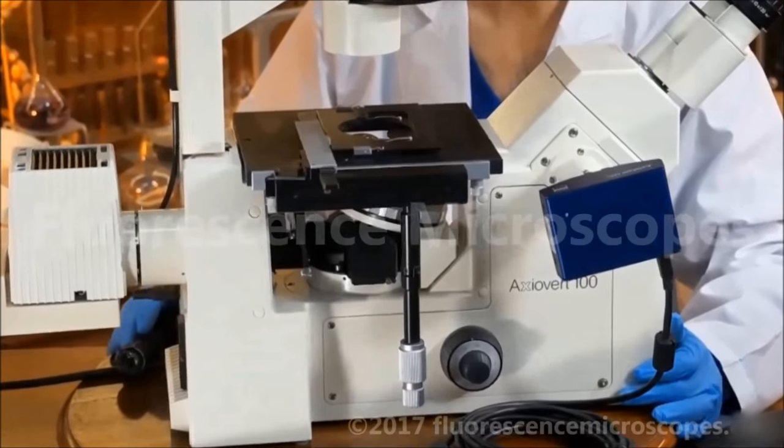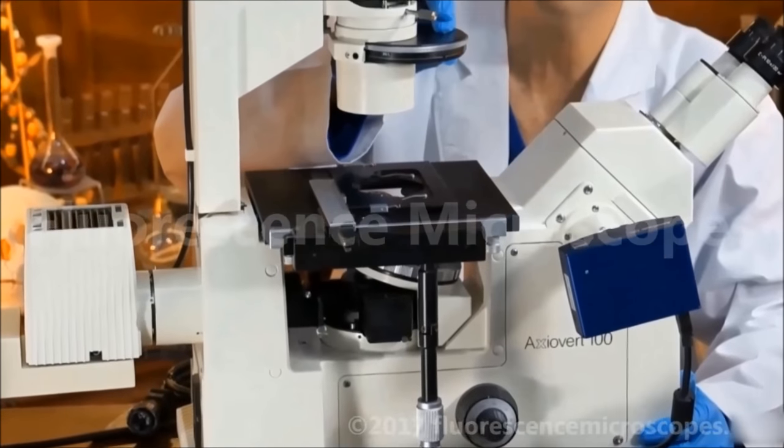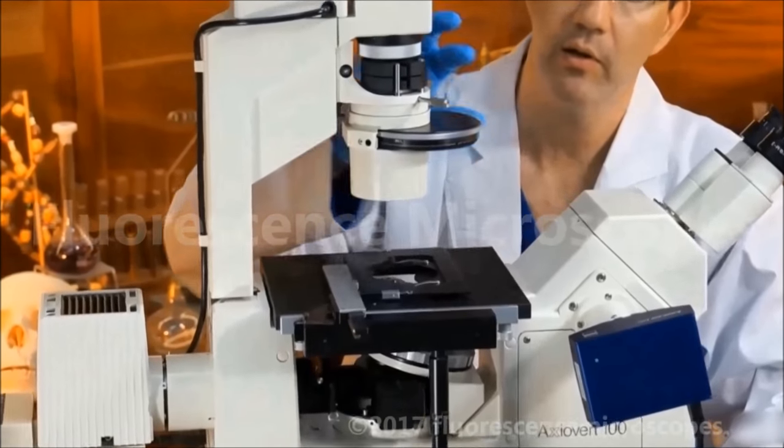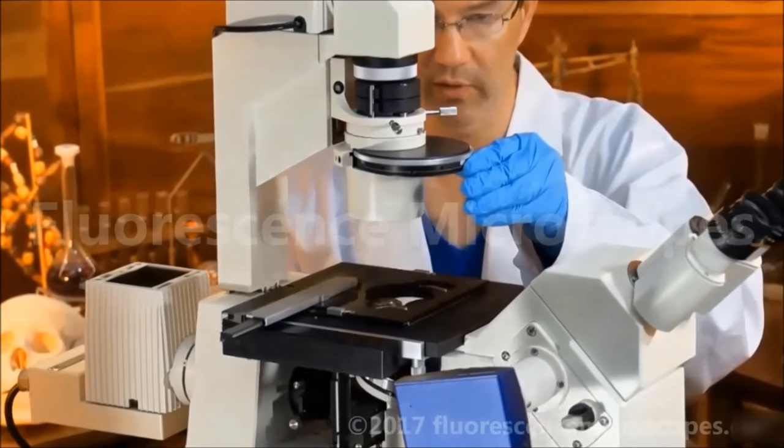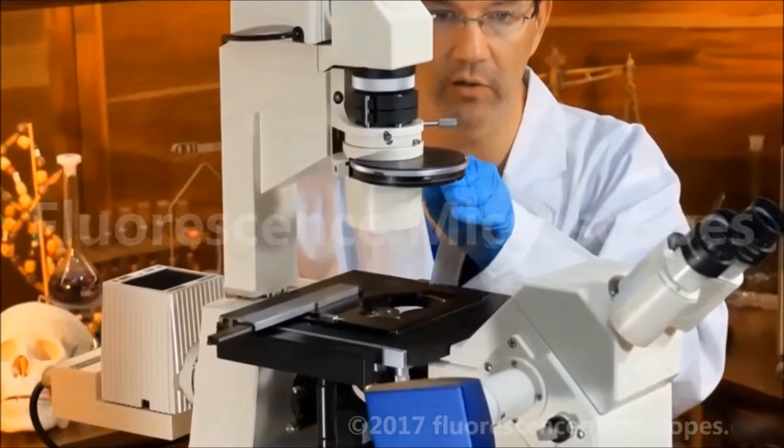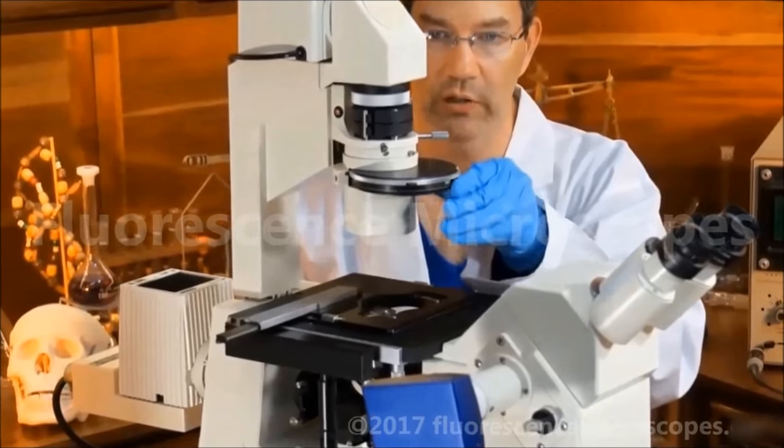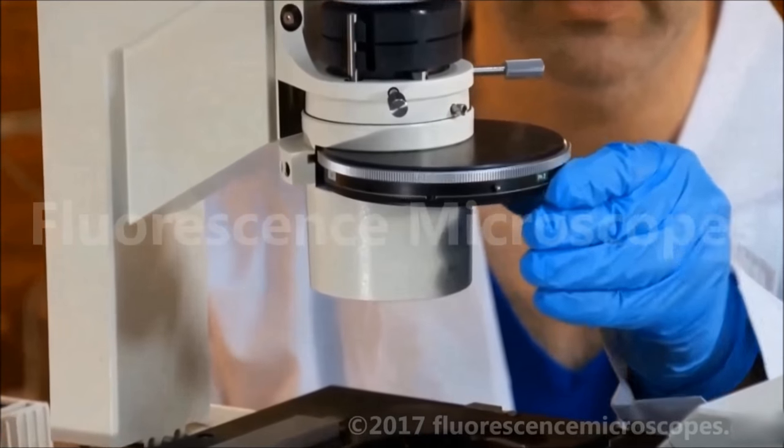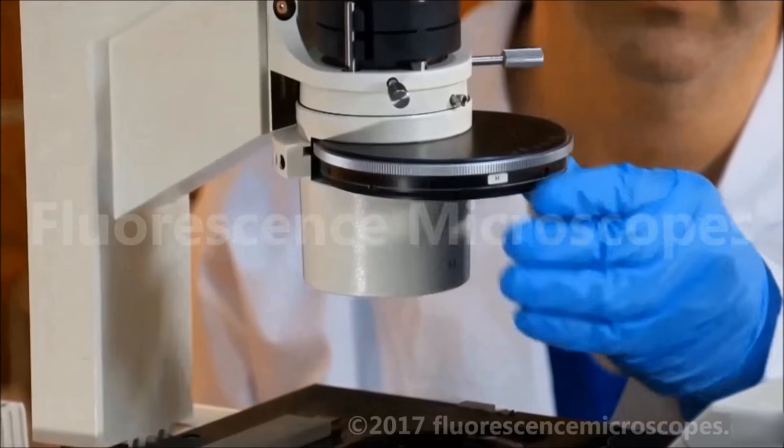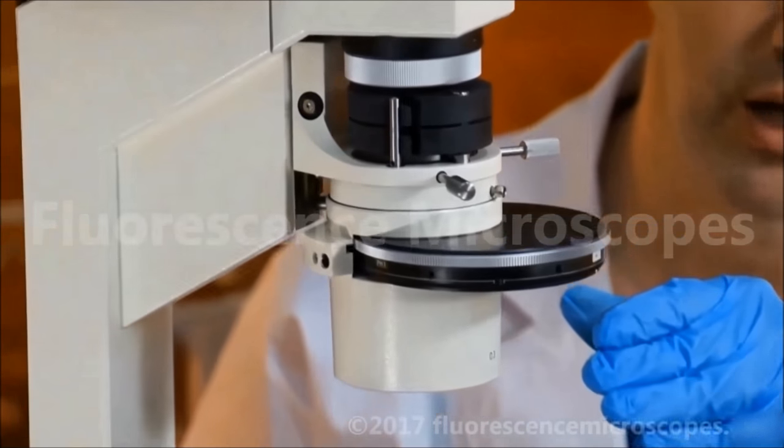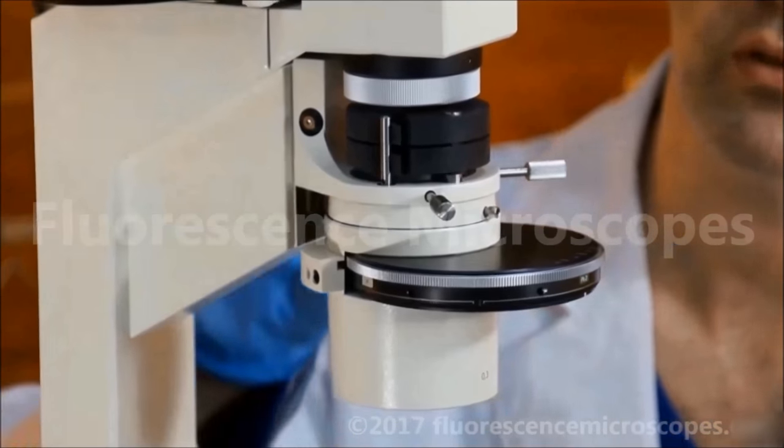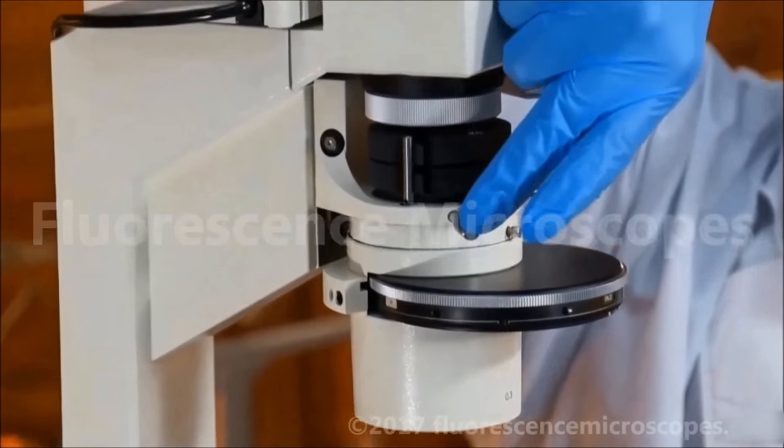Other features of this, we have a phase condenser. It's set on bright field. We can turn it to phase one, turn it to phase two, and back to bright field. The centering for the condenser is through these two knobs.